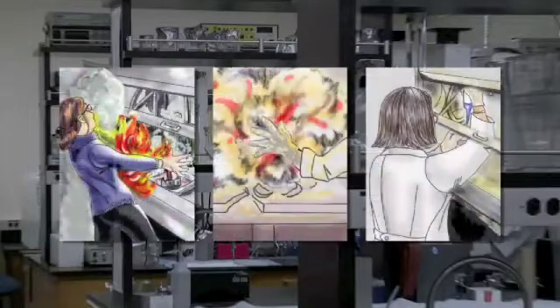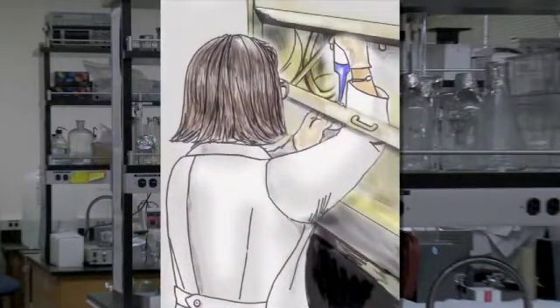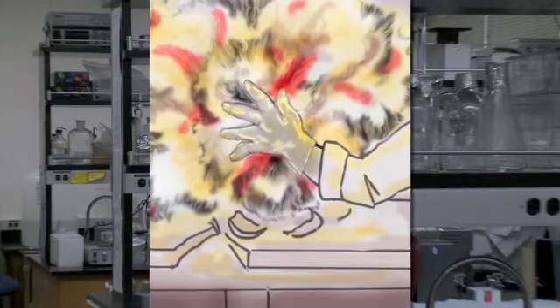This CSB video reports on three laboratory accidents: the 2008 fatality at UCLA, a death by accidental poisoning of a highly regarded Dartmouth College professor in 1997, and a 2010 explosion at Texas Tech University, or TTU, that severely injured a graduate student. It would be a shame if not every university stopped what it was doing whenever a major accident happens, like at TTU, like at UCLA, and take it as an opportunity to examine their own safety practices to determine what similarities there are.